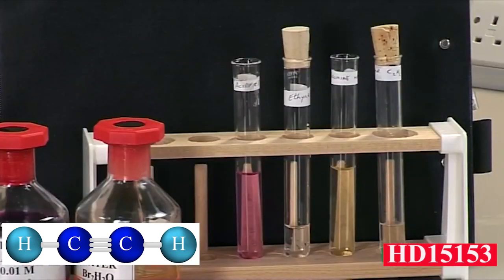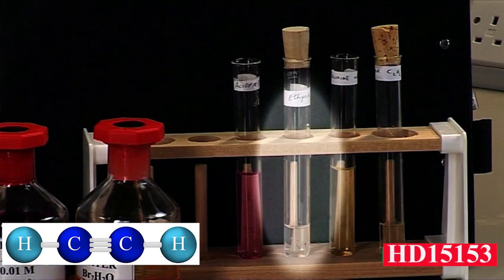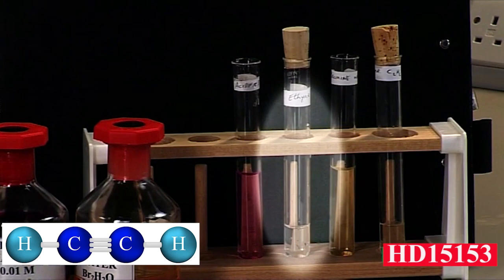The very reactive carbon-carbon triple bond reacts readily with the potassium permanganate.